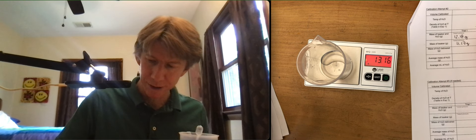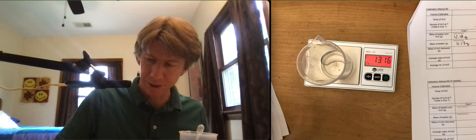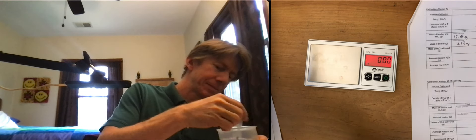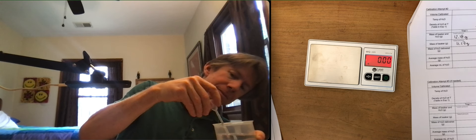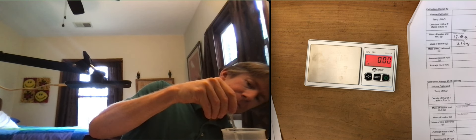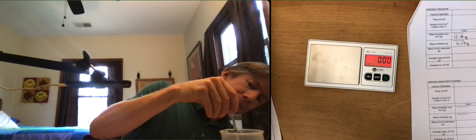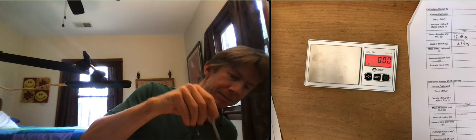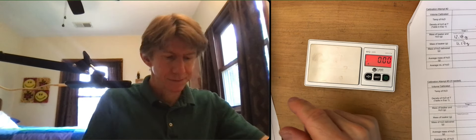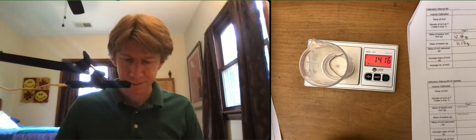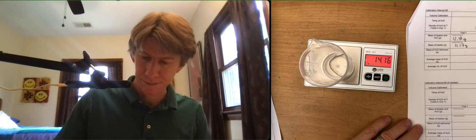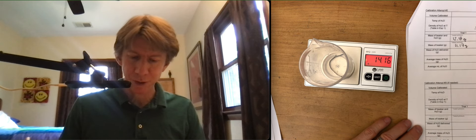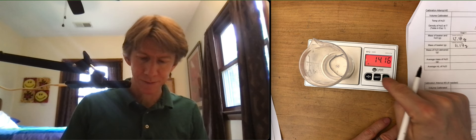13.16 grams. Snap. Take picture. 14.16 grams. Good. Turn that thing off.